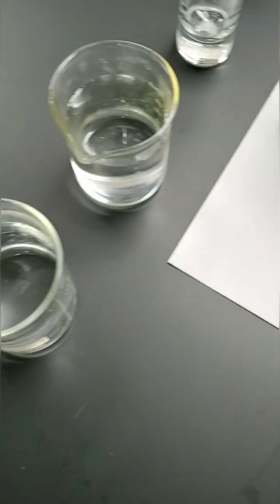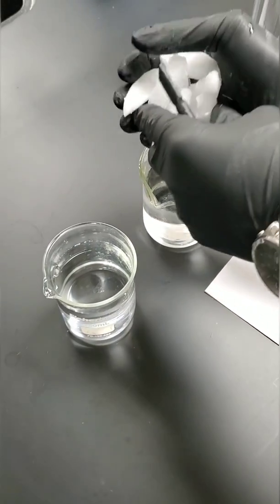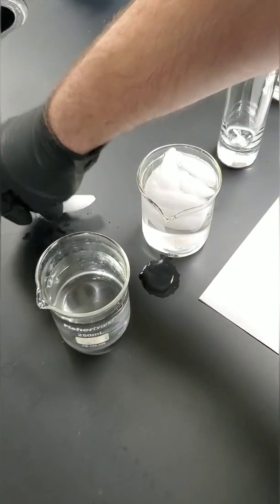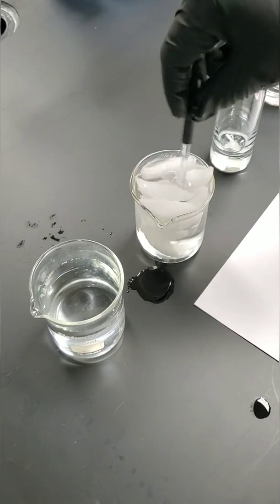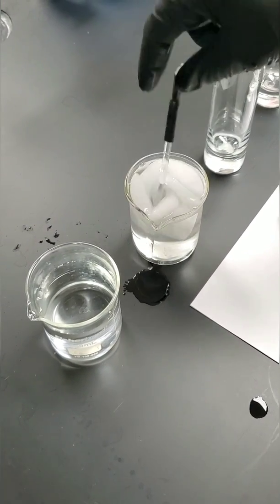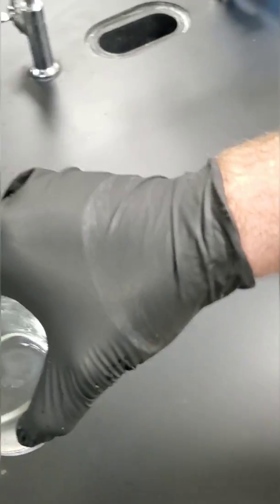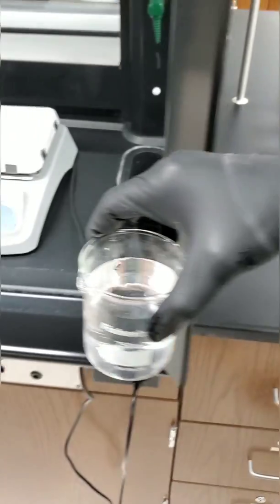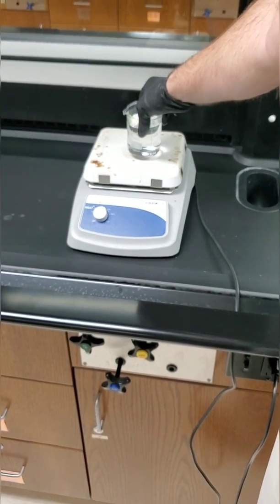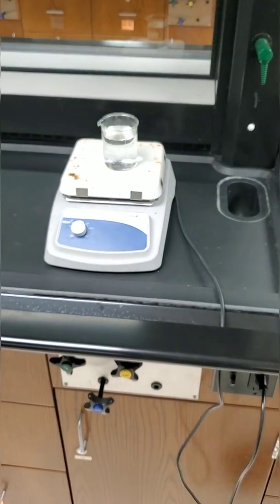All right, next is to add ice to one of these beakers and let that get cold. And this other one goes to the hot plate to get hot. I'll be back in a minute.